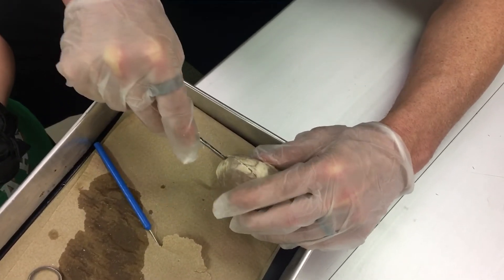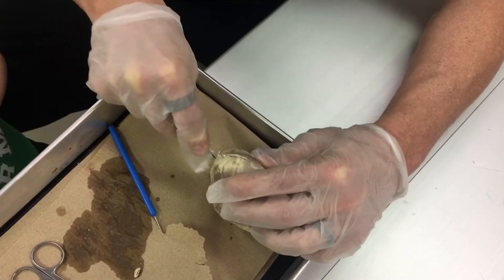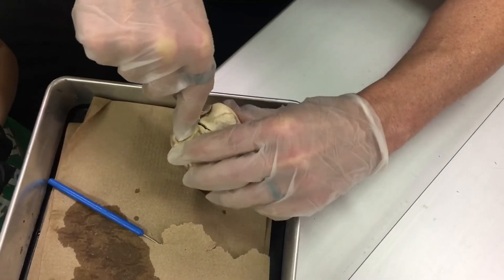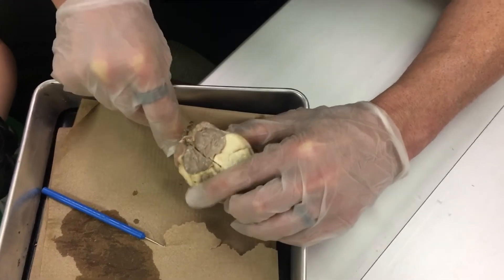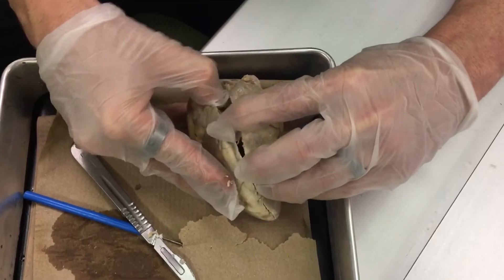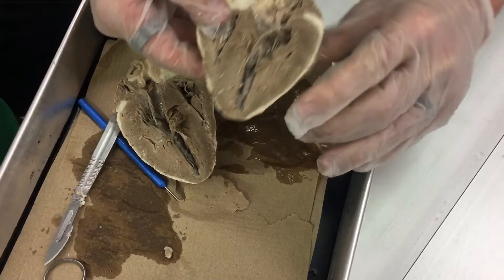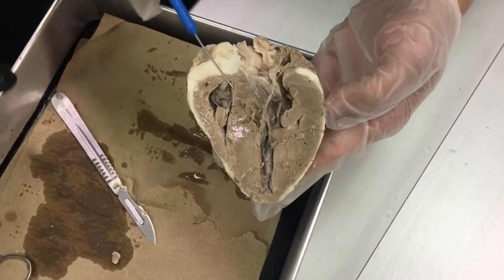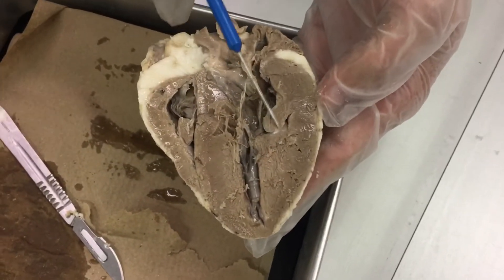What you can see from this cut is the size of the right ventricle versus the left ventricle. The left ventricle is much bigger because the right ventricle just pumps into the lungs which are pretty close, while the left ventricle pumps to the whole body. Here you can see the left ventricle, and the myocardium — the cardiac muscle — is really thick through here.